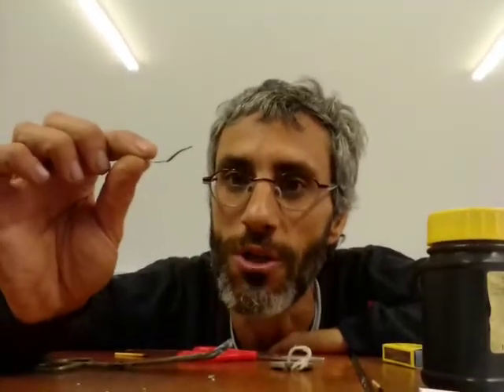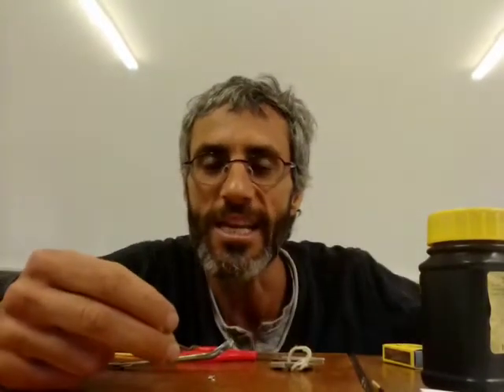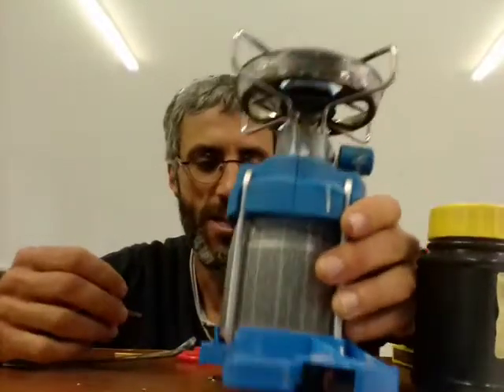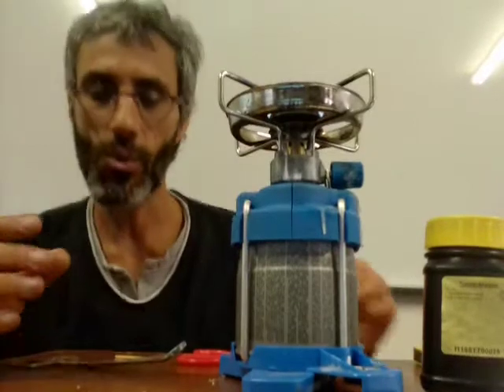Now, the reaction I'm going to show you is when it reacts with oxygen. But you know that there's plenty of oxygen around in the air, and right now it's not doing anything. So it's not that reactive. To make it react with oxygen, we're going to need to supply some heat.